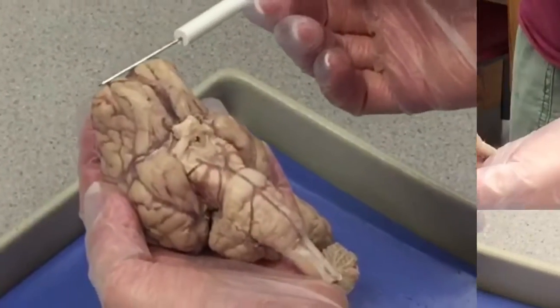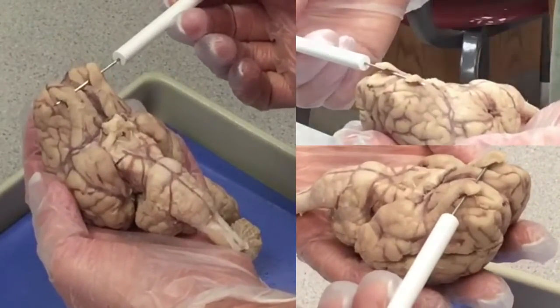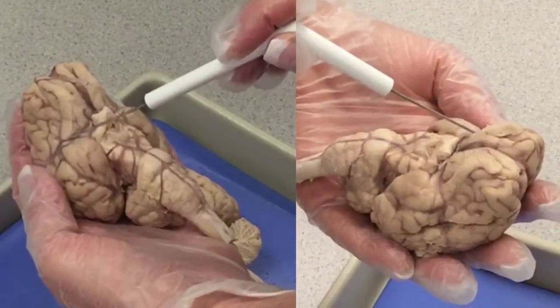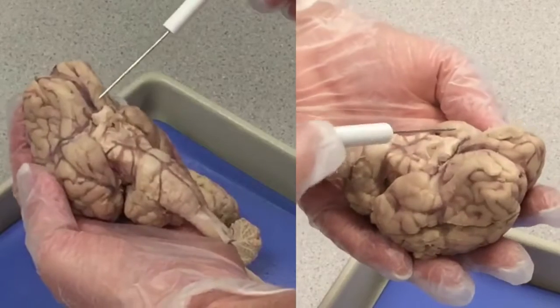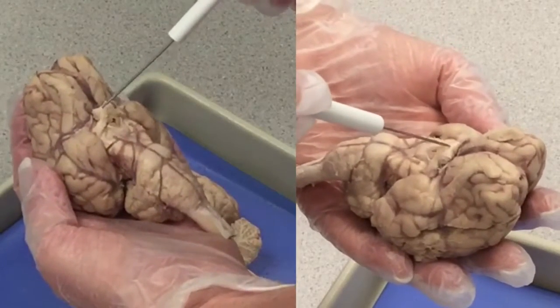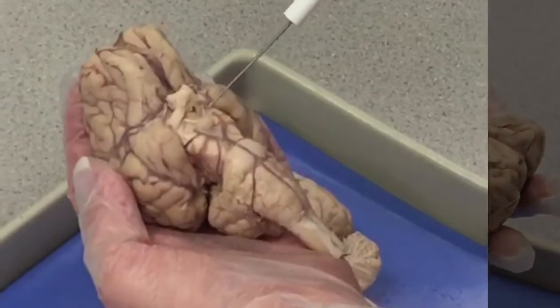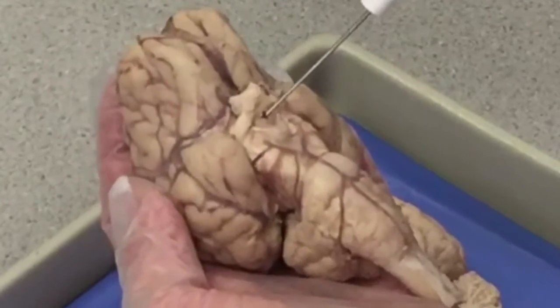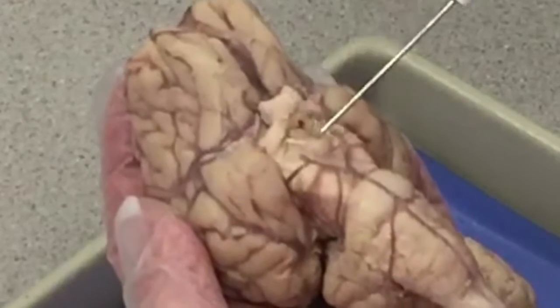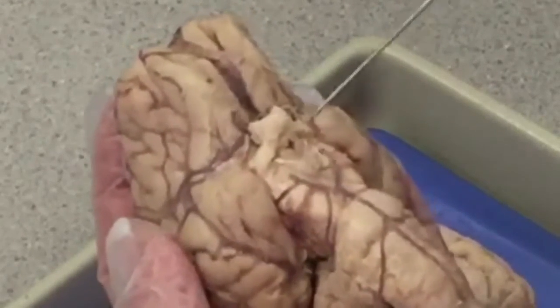As we look at the ventral surface of the brain, notice the 2 olfactory bulbs which connect to the cerebrum. Each olfactory bulb leads to an olfactory tract. The optic nerves and the optic tracts merge at an X-shaped structure called the optic chiasm. Near the optic chiasm are the mammillary bodies. This small hole is the infundibular canal. The optic chiasm through the mammillary bodies is the region that we call the diencephalon.